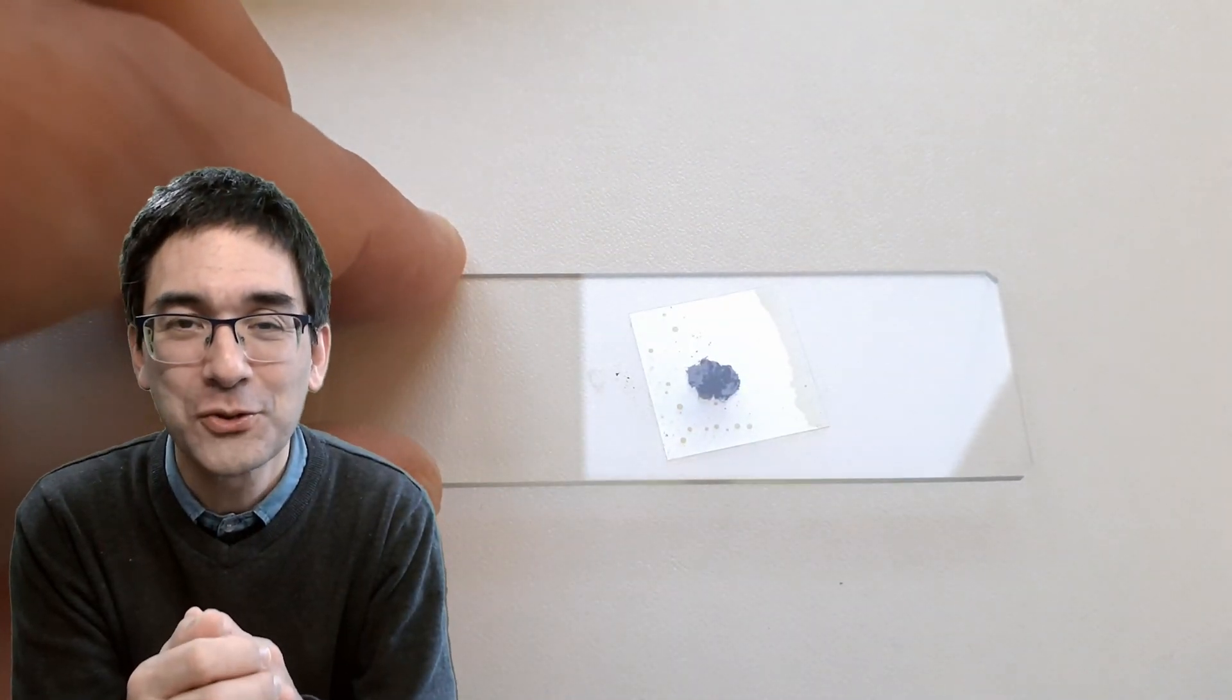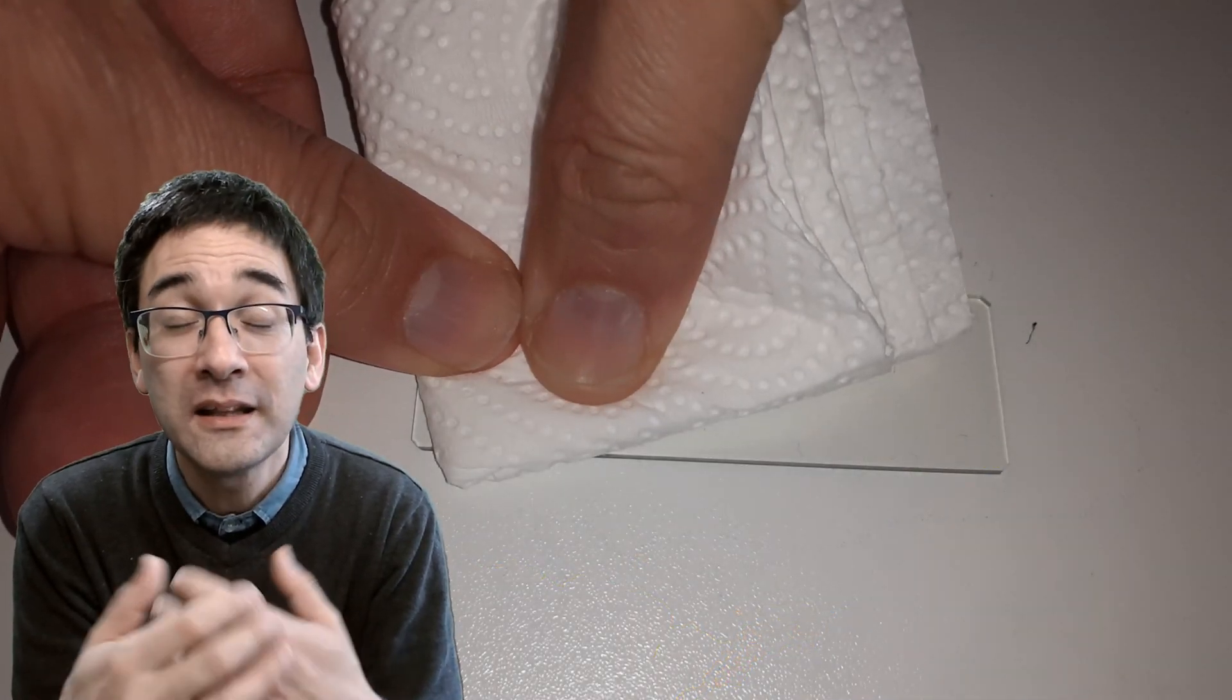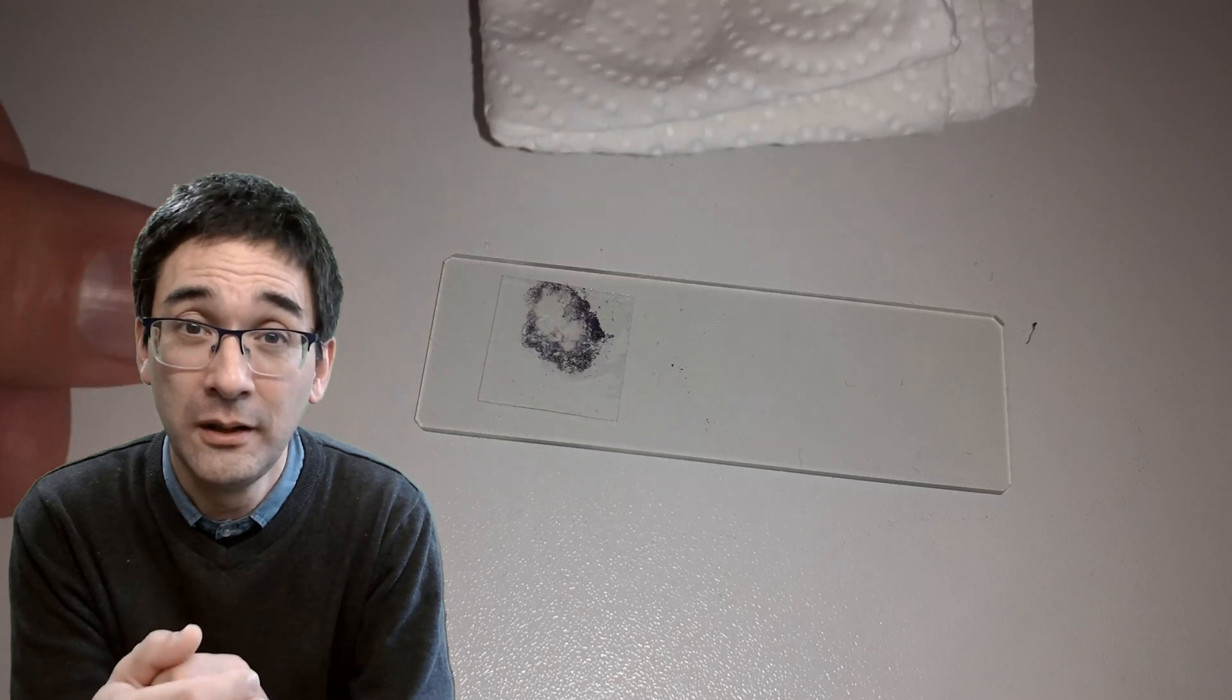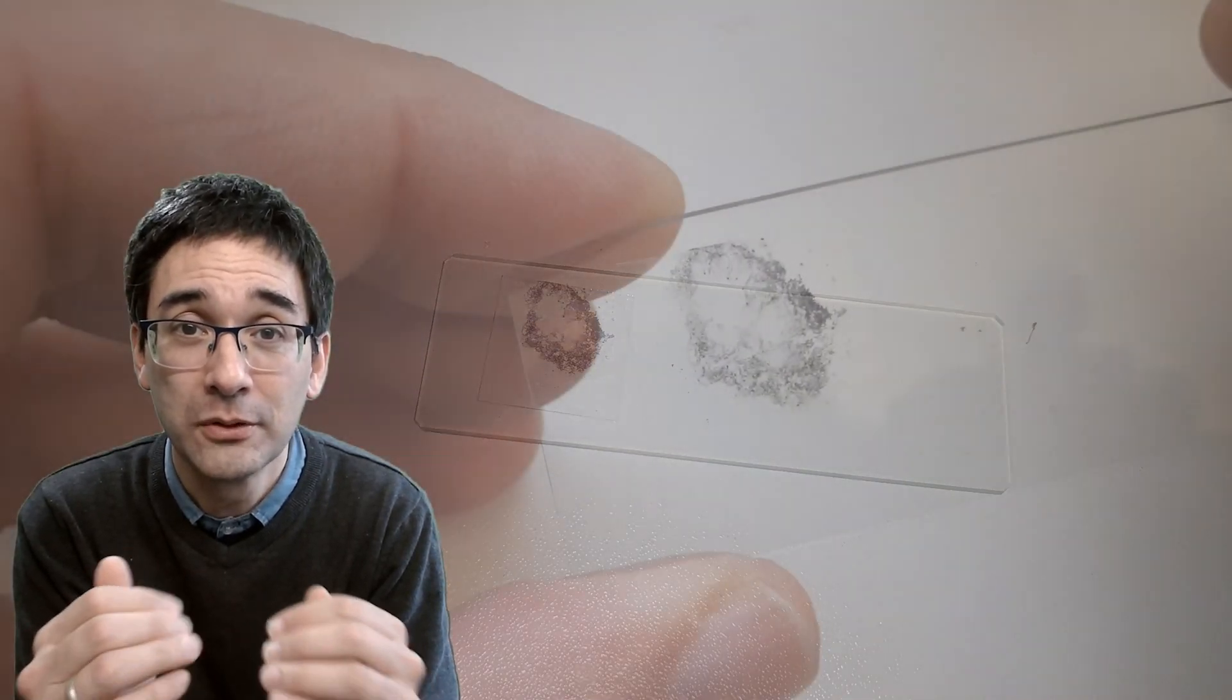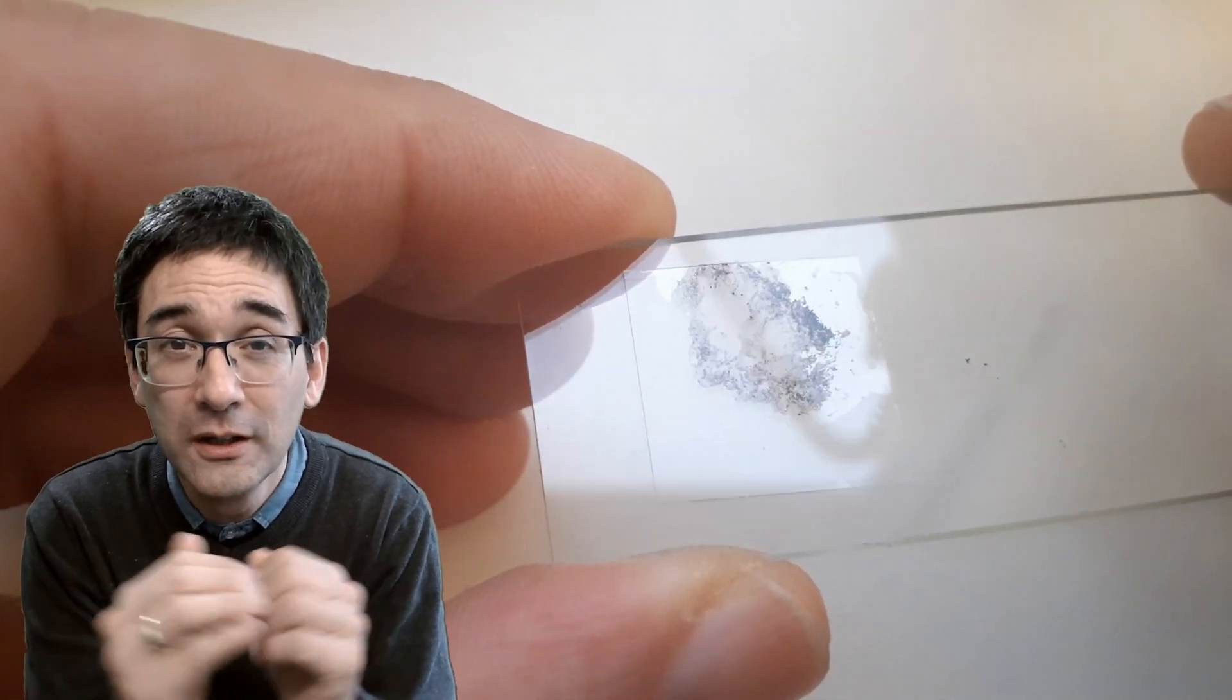And then everything went under the microscope and I was actually pretty disappointed. Look at this, this is all I found here, a black dark blob and no starch grains and no details or anything. So back to the beginning again, and now with much less material and a lot of pressure, I was able to compress it very thinly into a very fine film and very fine layer.